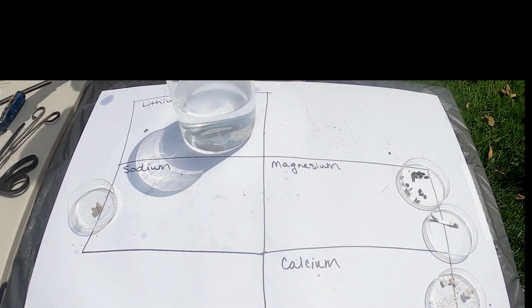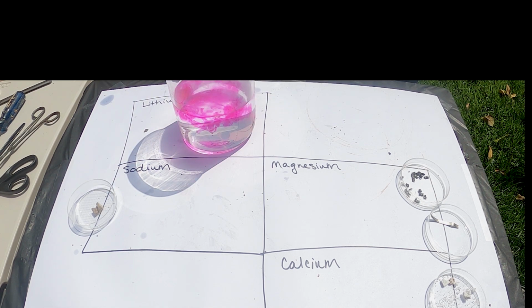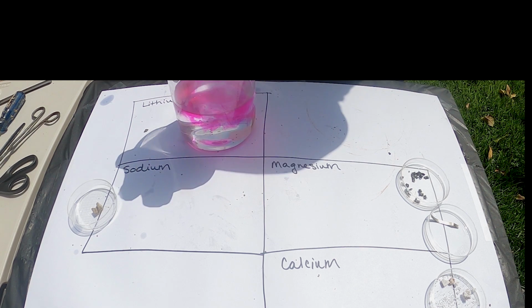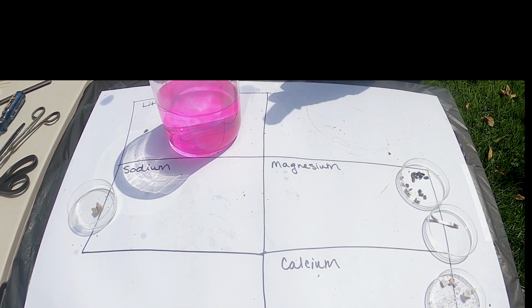Okay. One other thing I want to do to examine its chemical properties is add a drop of phenolphthalein. As you remember from the titration lab, phenolphthalein will turn a bright pink in a base. So when I put it in the solution that we've created, we can see if it's a basic or acidic product. So let's test. Pretty pink to me. So that indicates a basic product.